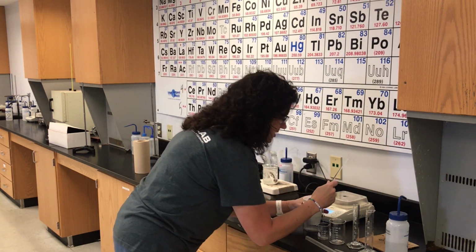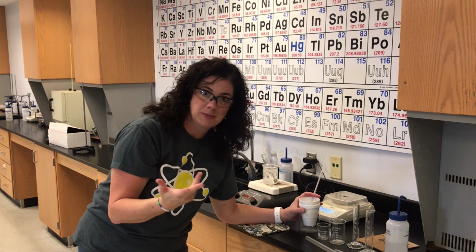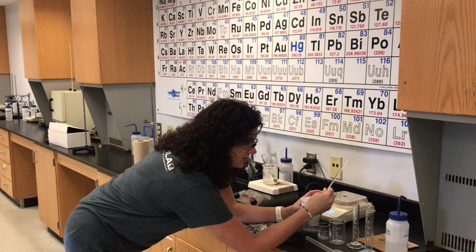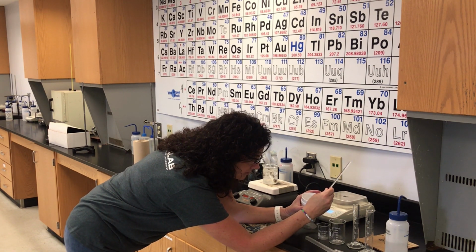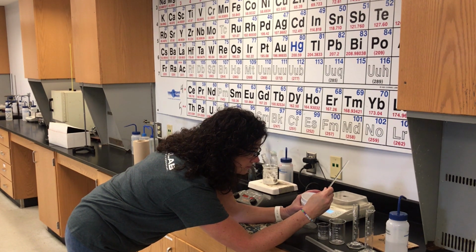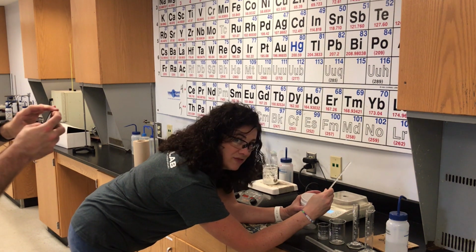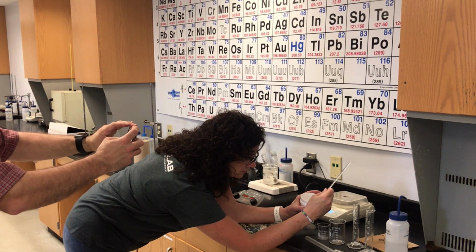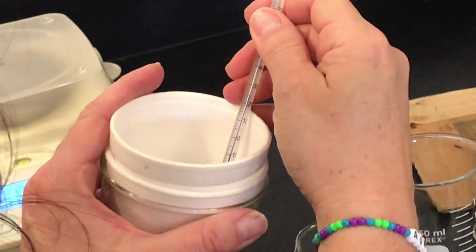Okay, so this water ought to be close to room temperature, which is, y'all can't tell, but to me it's warm in here. So we're looking for like 20-something degrees Celsius. I'm still coming down a little. I'm at 25 degrees Celsius now. I'm going to make sure it's stable there before we record that.